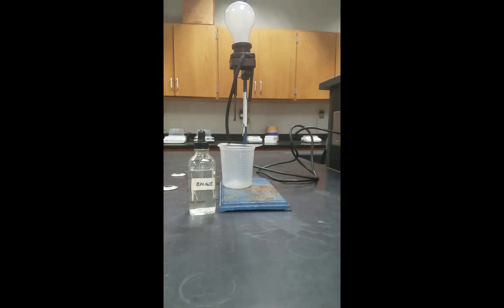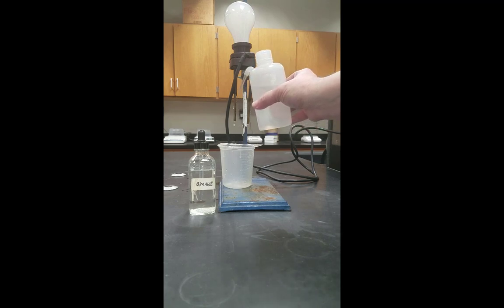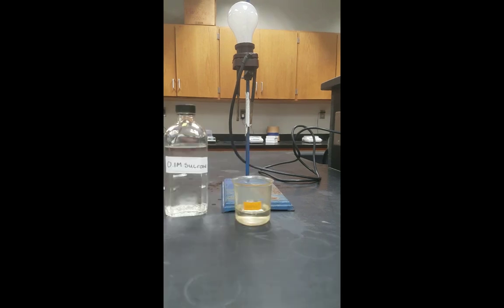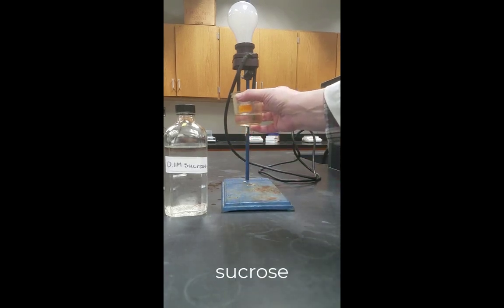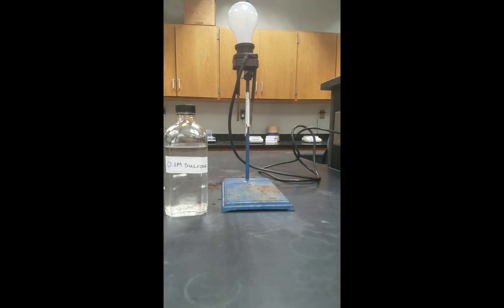Now I have to rinse off those electrodes with deionized water between each test to make sure that no ions remain on the electrodes before I go to the next test. Here we have the sucrose solution. Let's see what happens when we test that. Nothing seems to happen, even when I shake. So the bulb does not change its brightness at all.